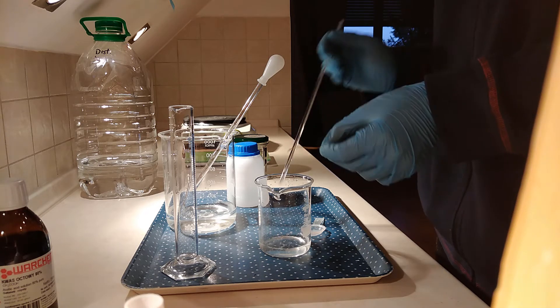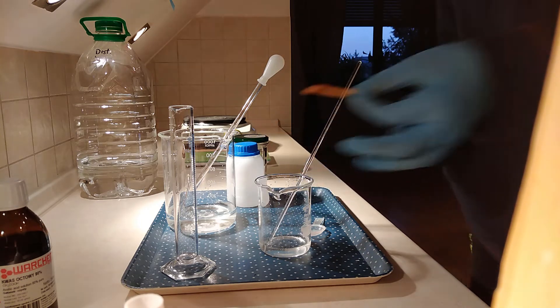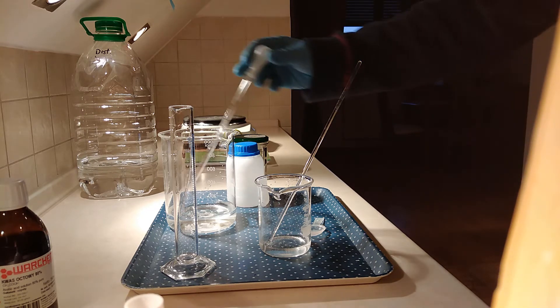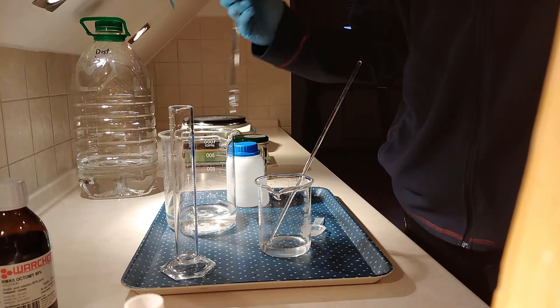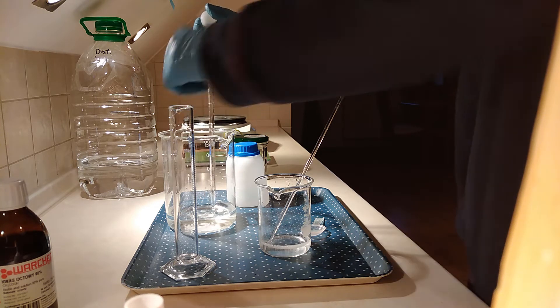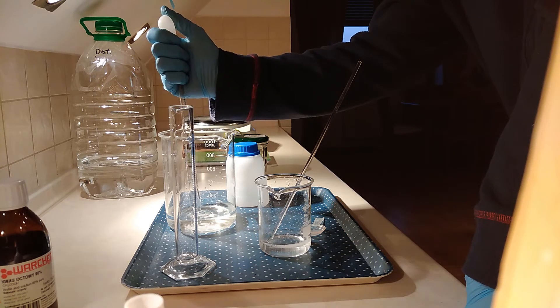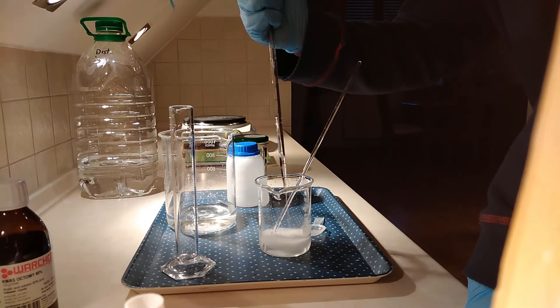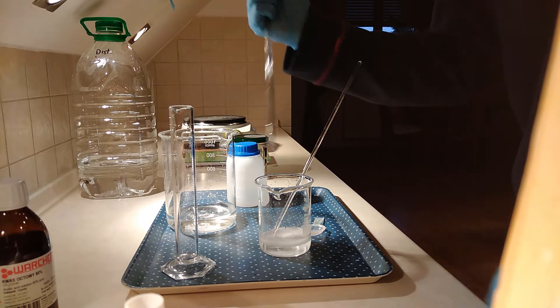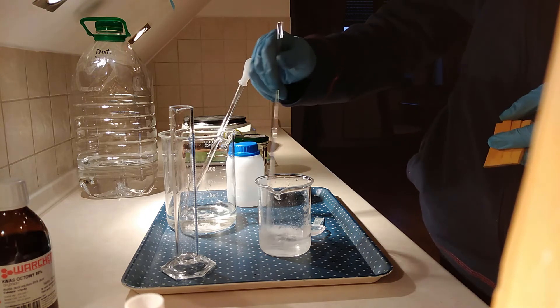Alright, it's slightly acidic. Yeah, it's slightly acidic, but most of the acetic acid has already been neutralized, so I think we may be able to add more to make more sodium acetate. Well, obviously, I forgot about the stirring. This is my terrible DIY titration setup — it's not really a titration, but still measuring the pH while neutralizing an acid.